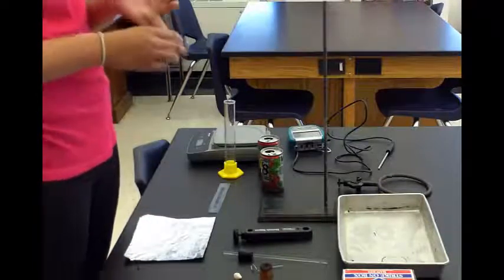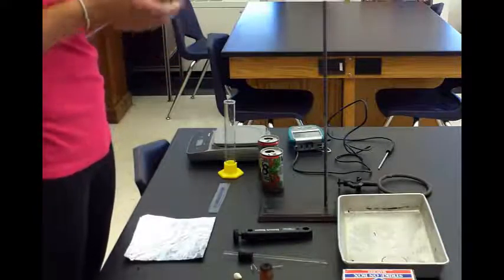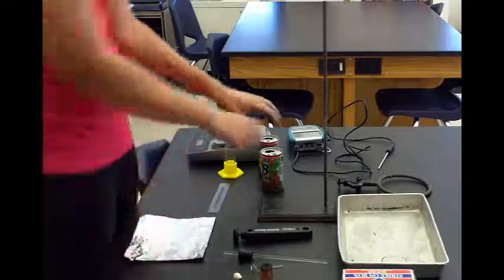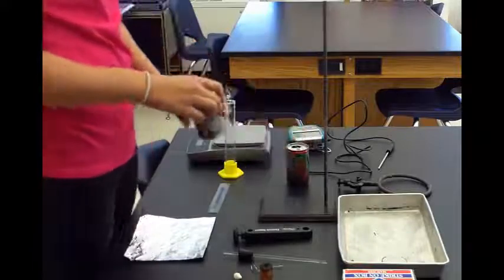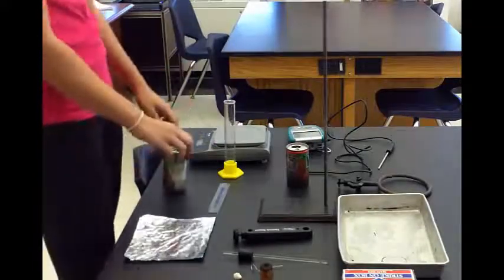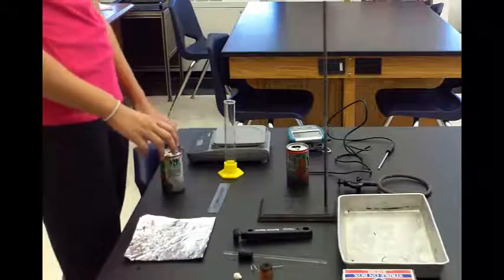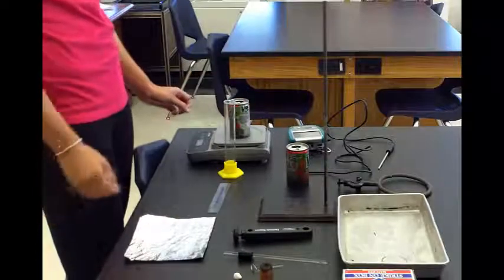You don't need gloves because there's no acid or bases, but your hair has to be back. If it's not back, we're going to make you go into the hallway. You have two cans in your basket—you only need one for the first part because you'll receive two foods. For the first can, turn on your scale, make sure it's in grams, and once you see the scale is at zero, put your can on and weigh it. Record the weight in grams.